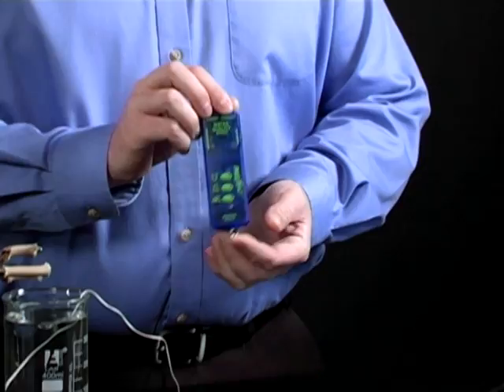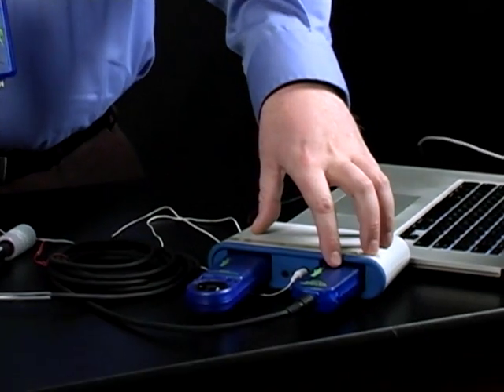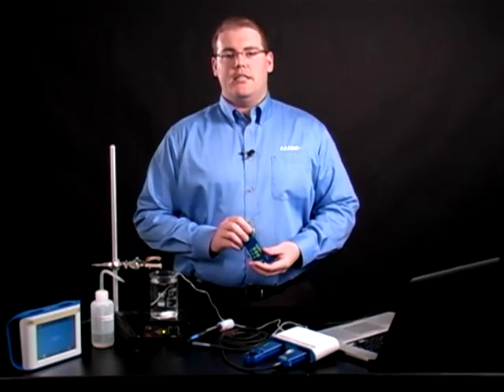It doesn't matter whether using the water quality sensor or the dissolved oxygen sensor, the calibration technique is the same.